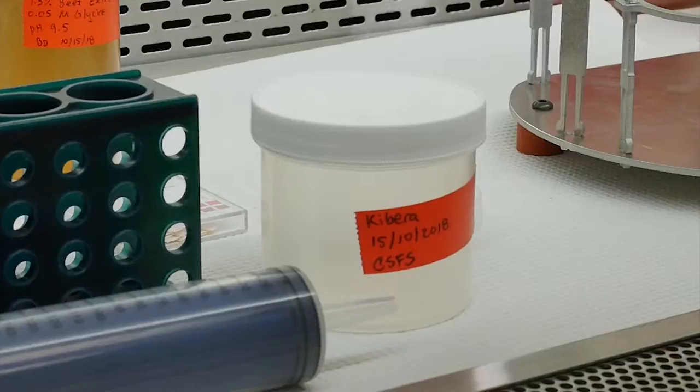For example, include the filter ID, sampling location, date, and your initials.